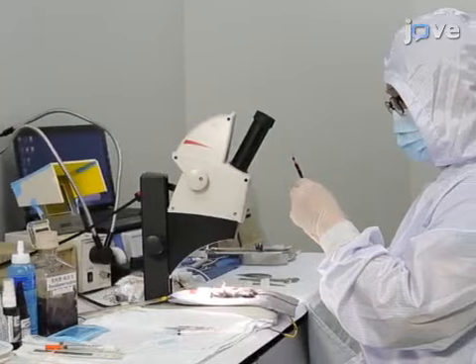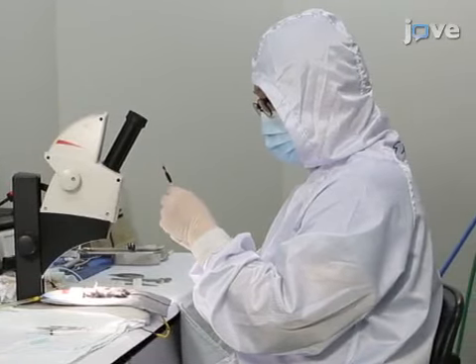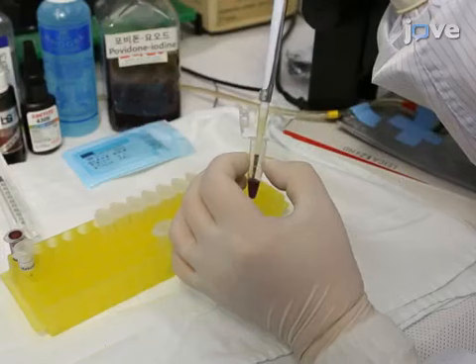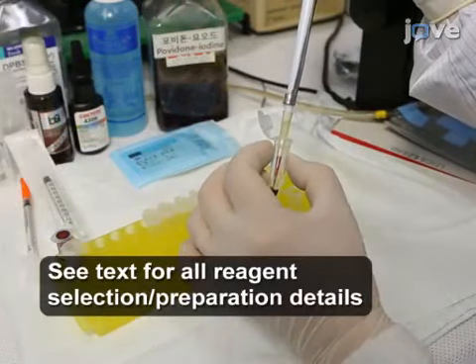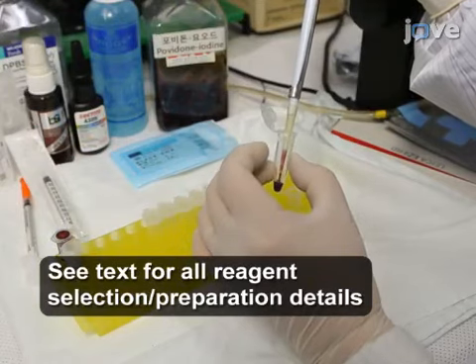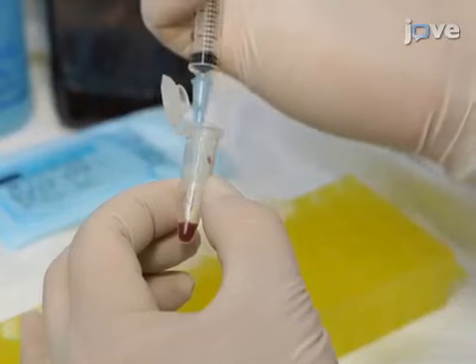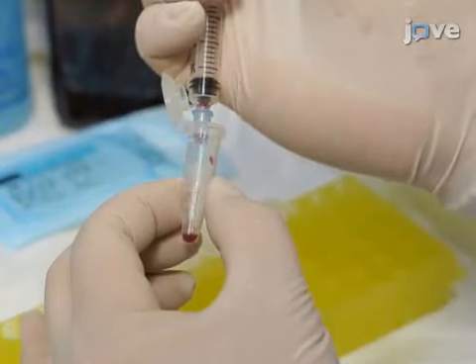After collecting 300 to 1,000 microliters of arterial blood by cardiac puncture, add 70 microliters of the sample to 30 microliters of the appropriate activated coagulation factor 13-mediated fibrin cross-linking activity-sensitive fluorescent probe, and load a 3 milliliter syringe equipped with a 23-gauge needle with the resulting mixture.